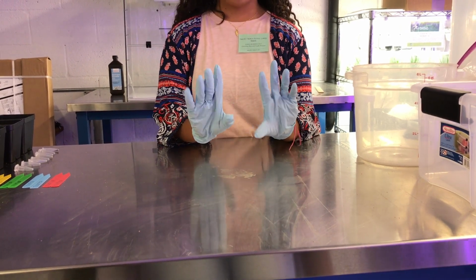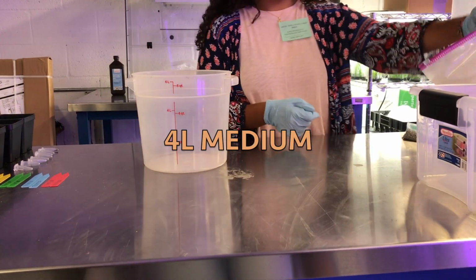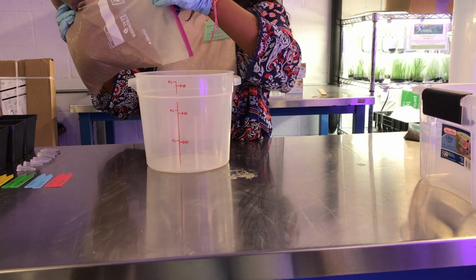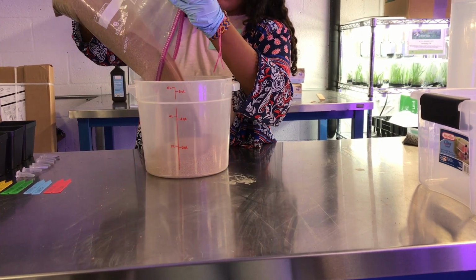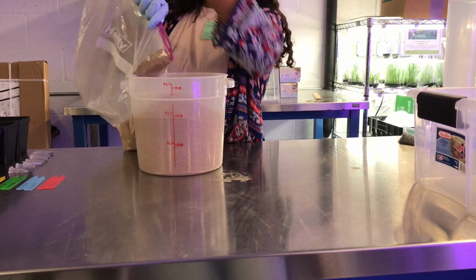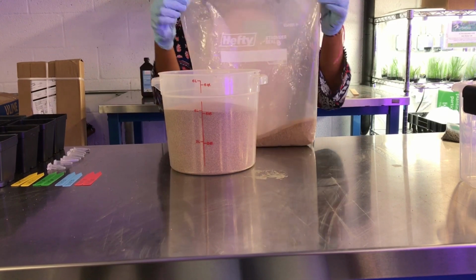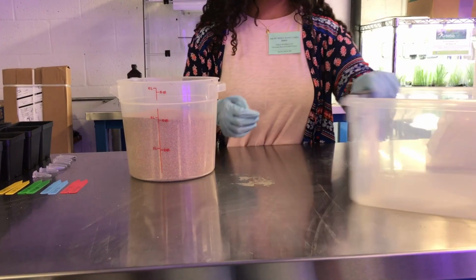I'm going to be showing you how to plant your seeds. Just to let you know, gloves are optional. So, you should first have some medium. You will need to measure out 4 liters in total. After measuring, pour the medium into a bin for mixing.